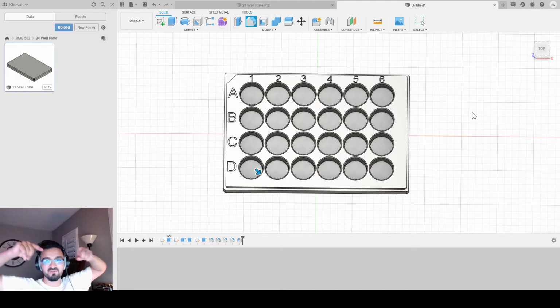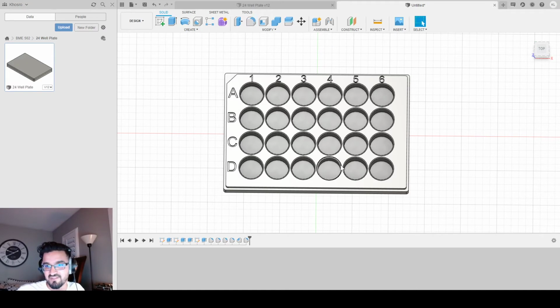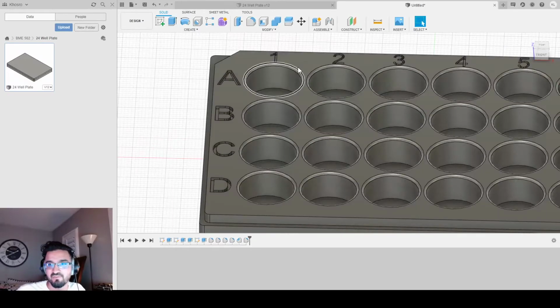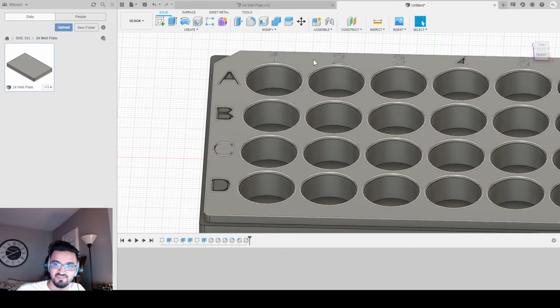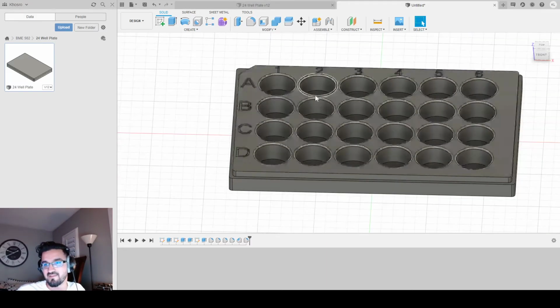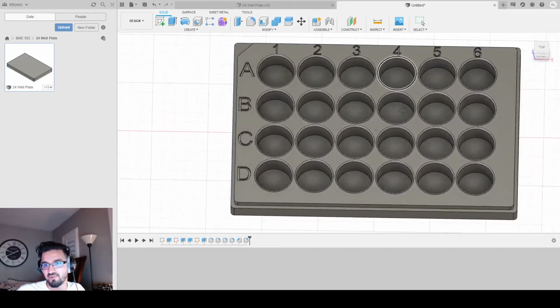It's going to give a rounded shape to the outer edge of the well, which, if you notice closely, most 24 well plates have this rounded dip before it goes into the well. It's not really sharp. So it just makes your 3D model more accurate, per se, because now you have these dips. So if you look, you have a little nice dip for your tip to go in. It's not just a sharp corner, you know? And I'd say that's pretty much done. You have a 24 well plate.